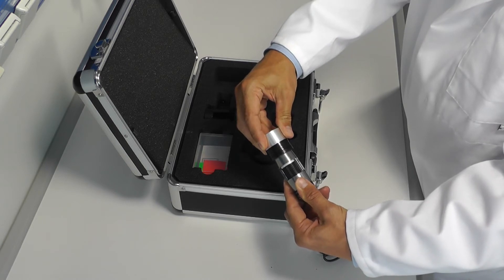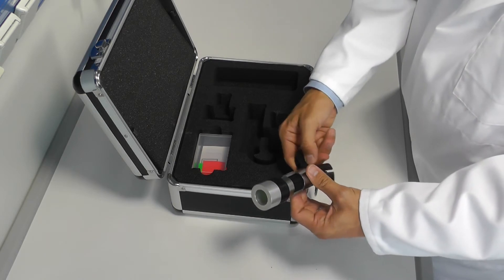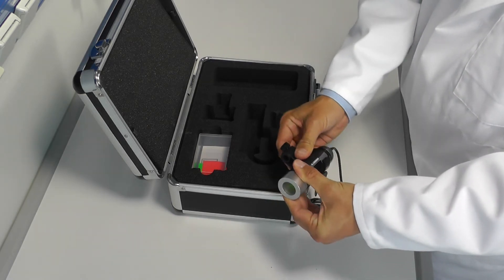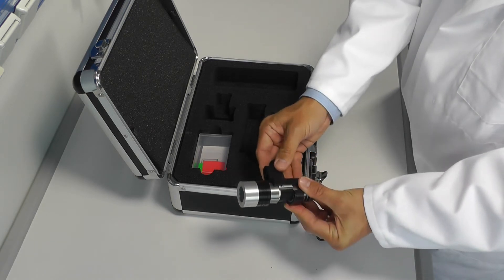The adapters are available in different sizes. The scope of supply also contains a special holder. Put the wire through the opening and slide it on. You are still able to operate the focusing dial.